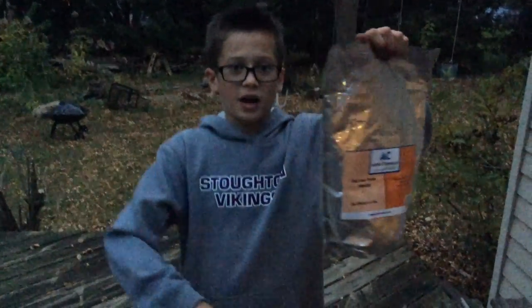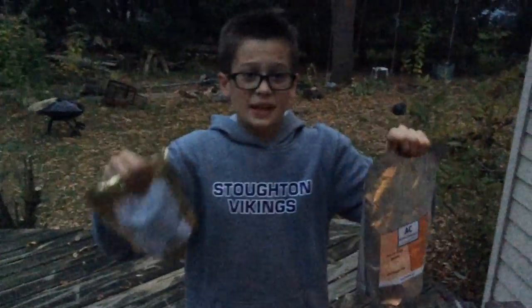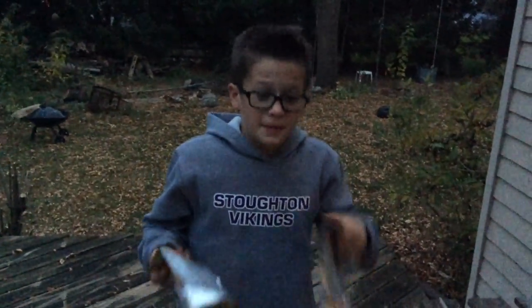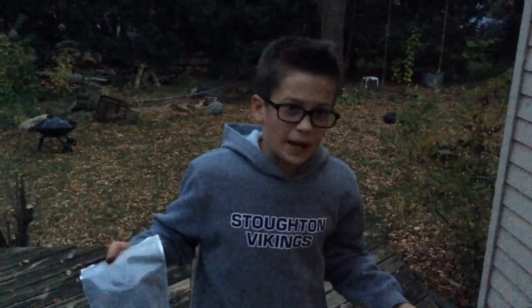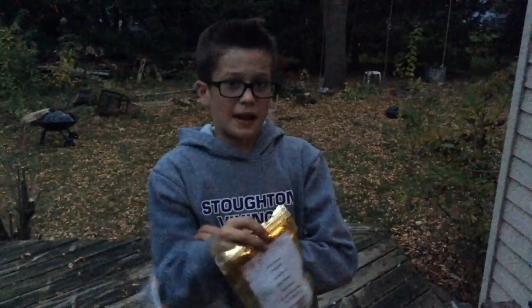This is my iron oxide. This is my aluminum. I mix these together to make a composition. The composition ratio is you have to do it by weight. It's 2.7 to 8, with aluminum being first. And as you can see, this aluminum is a silvery color like you see in aluminum foil.